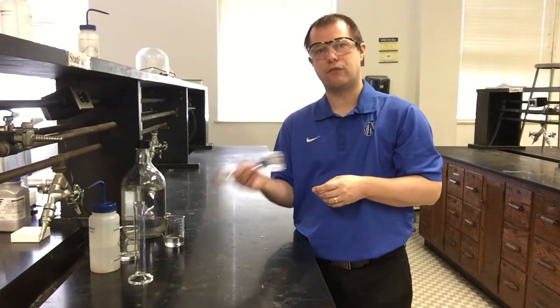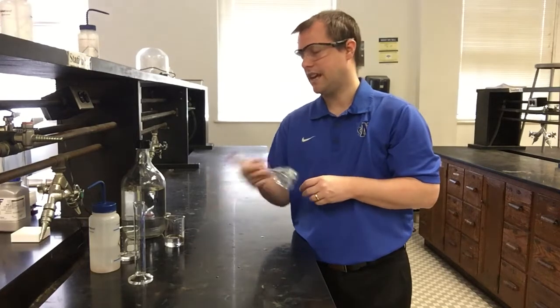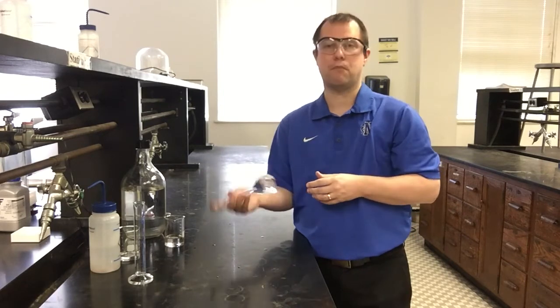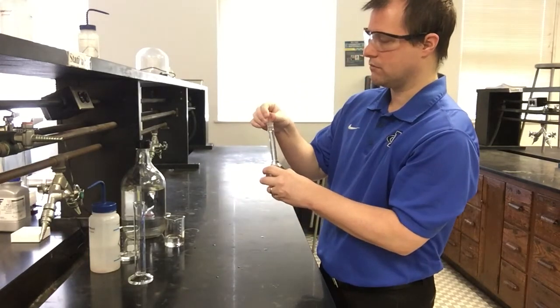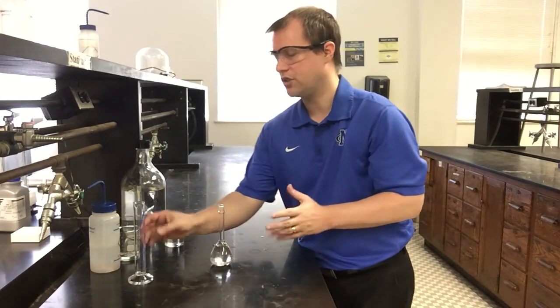So I'm going to go ahead and invert this a few times, vent kind of like we talked about before. Do the same probably a couple more times here. And then what I'll do is fill up this liquid level to the very last little bit, as far as that marking on the neck of this volumetric. And then we'll have our two solutions prepped and ready to go. All right, so it should be good and nice, thoroughly mixed. There's nothing to dissolve this time, so the solution should mix quite a bit faster.